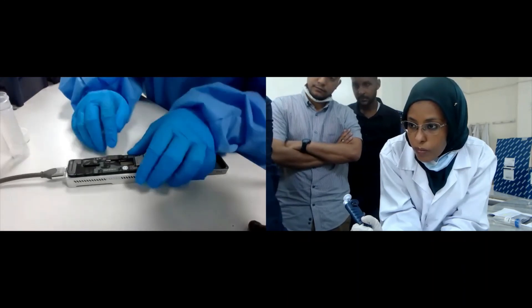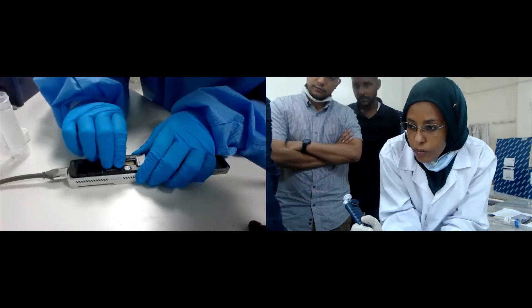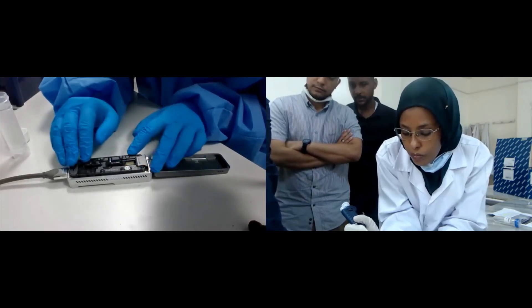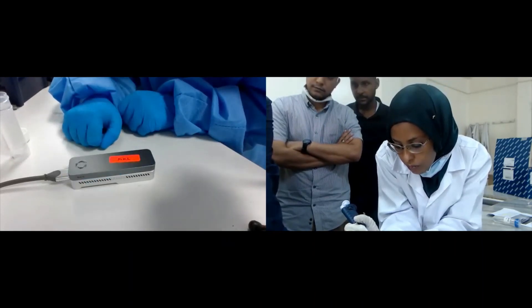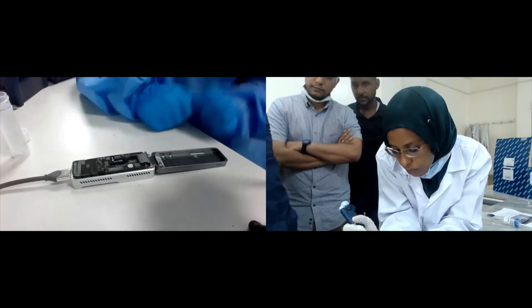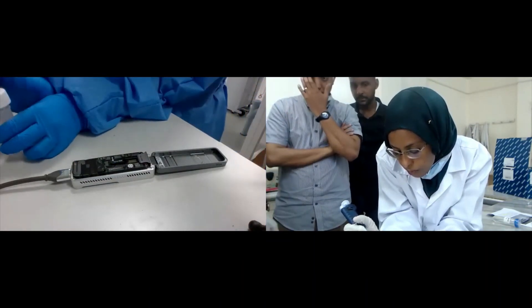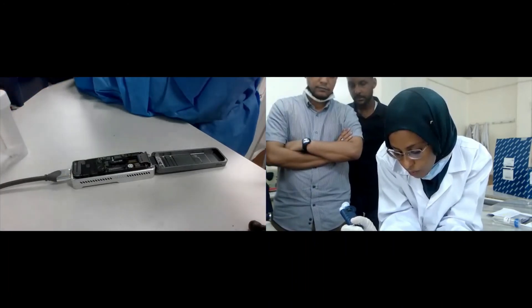You don't want to press your pipette in because you risk adding air into the panel — just drop it on. That's the flow cell loaded. When you're starting to run it, you just need to gently put the lids back on the holes, close the flow cell, and it's done. That's how to load buffer and also load your sample.